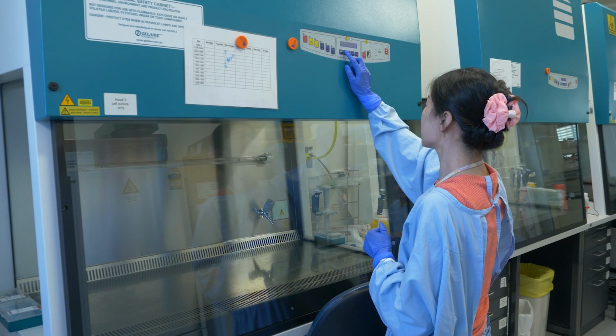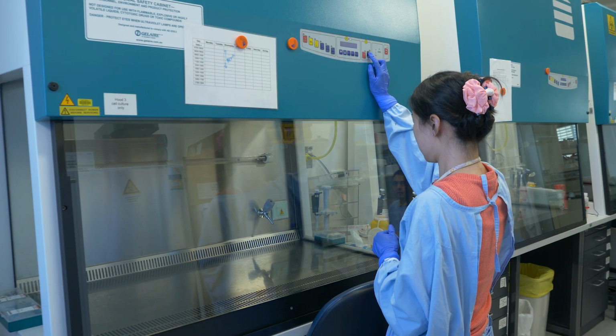Hi, I'm JJ, and now I'll be showing you how to use the carbon quantum dots that we just synthesized to introduce them into cells as a biosensor to sense ferric ions in the cells. Okay, so first of all, we need to culture the cells.